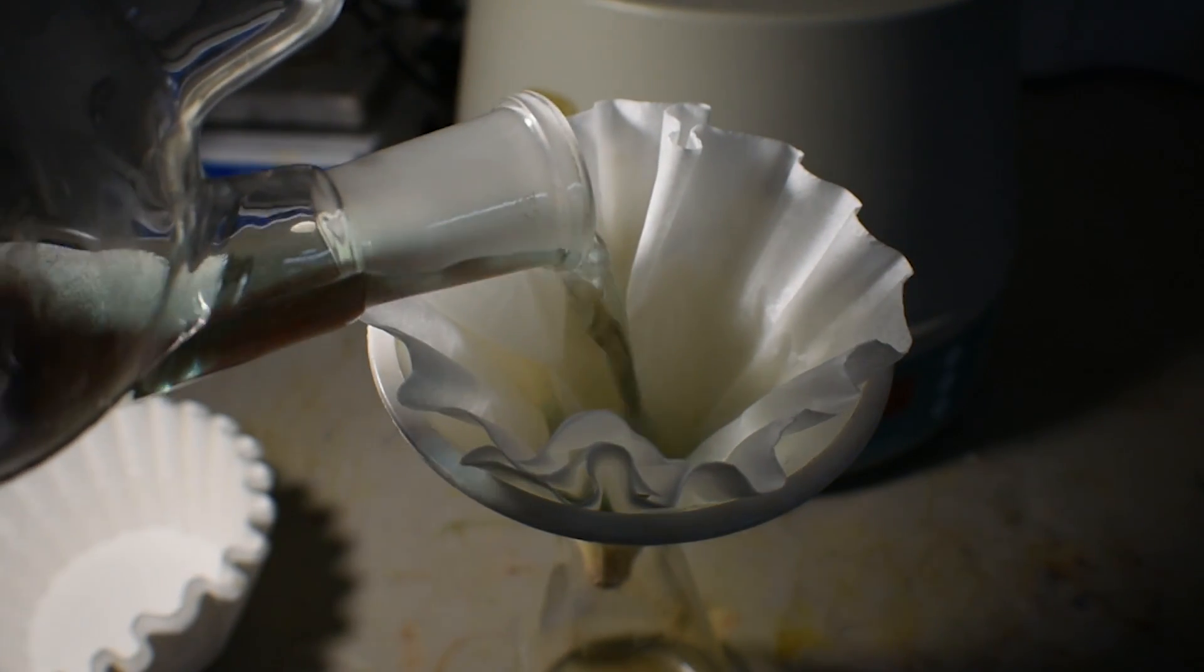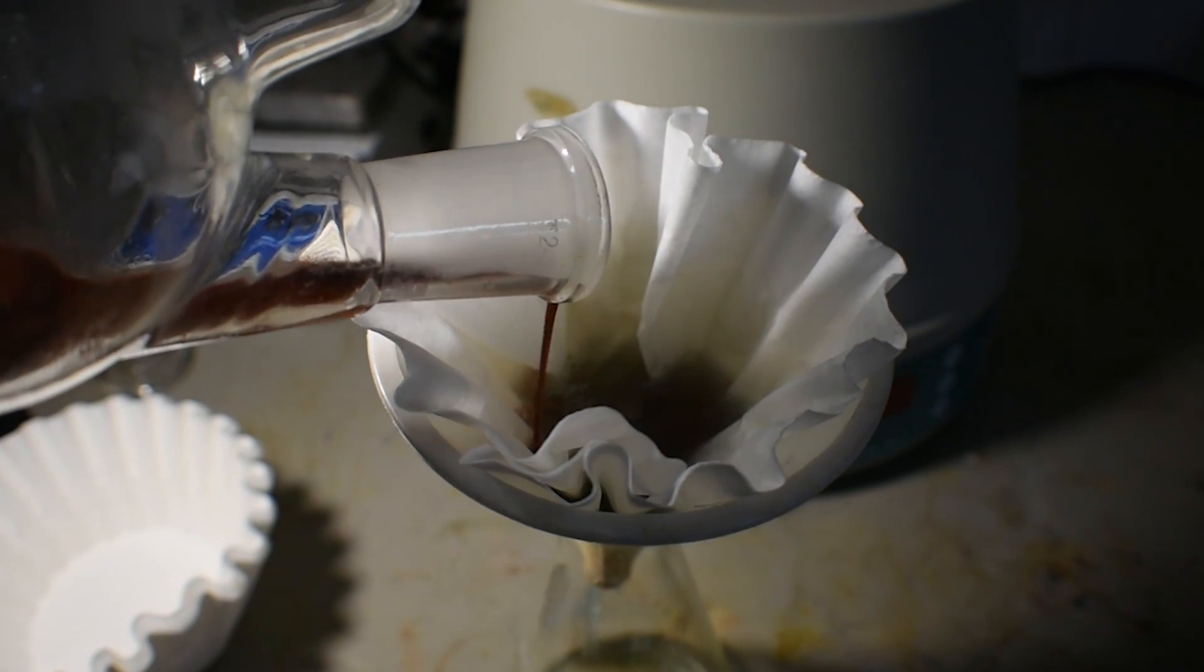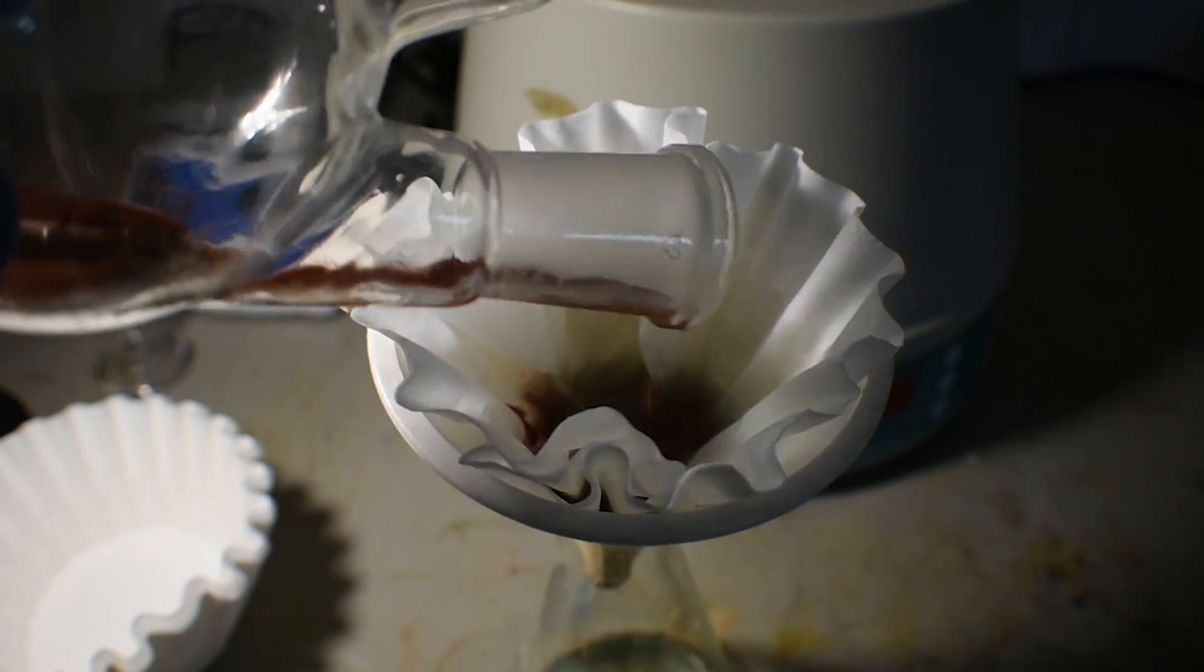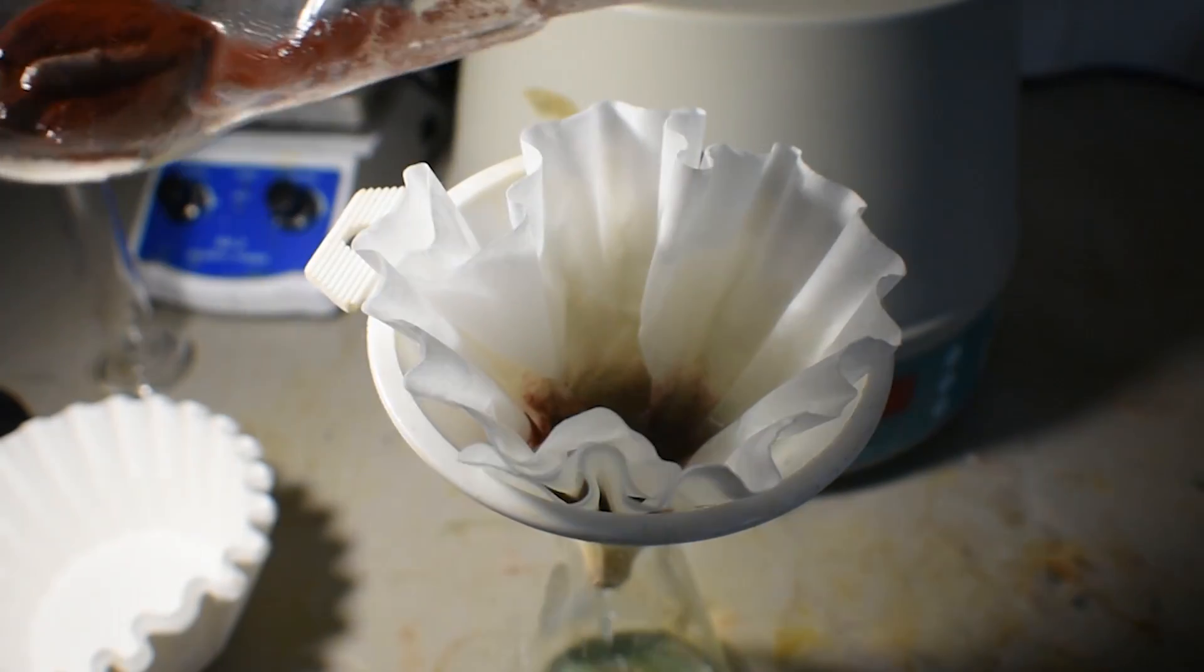Once everything had filtered through, the solid was washed twice with cold water and agitated in the funnel so as to remove any soluble copper that was stuck to the product.